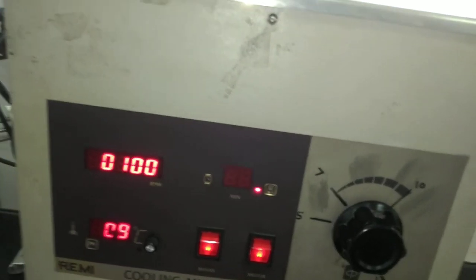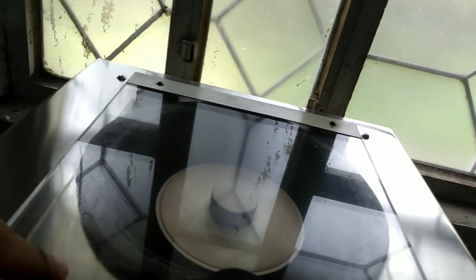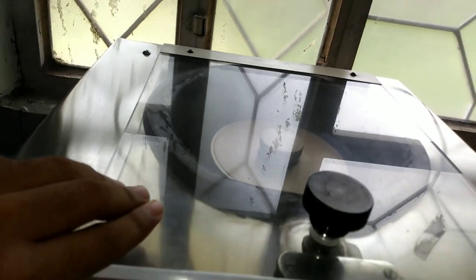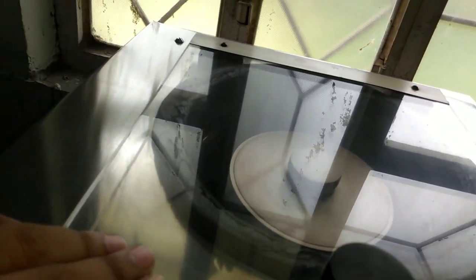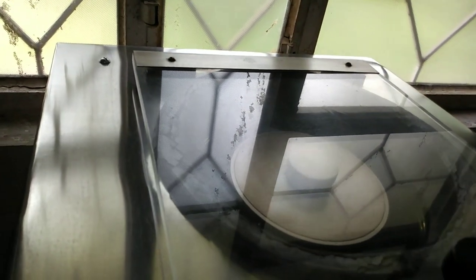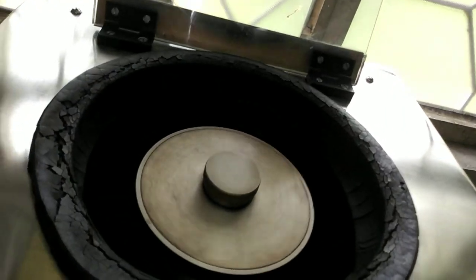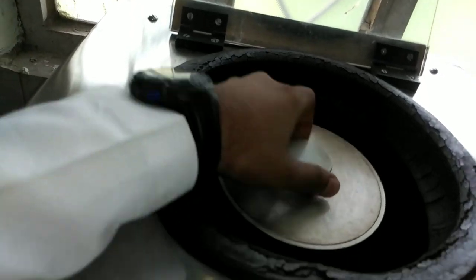As you can hear, it is rotating. You can see at the top it is rotating. The cooling machine also turns on when I switch it on. Now I will turn it off and show you what is inside.